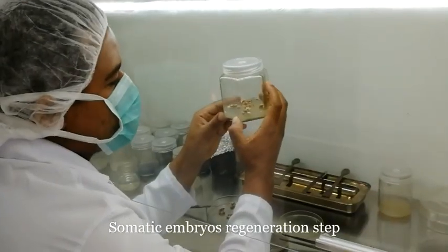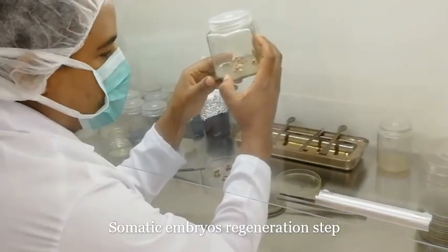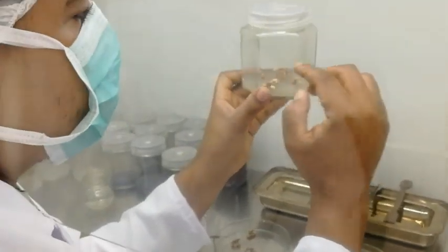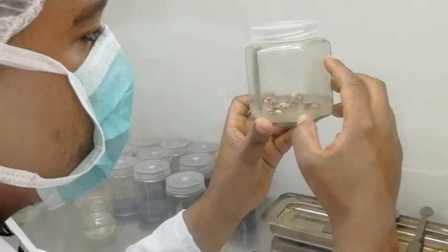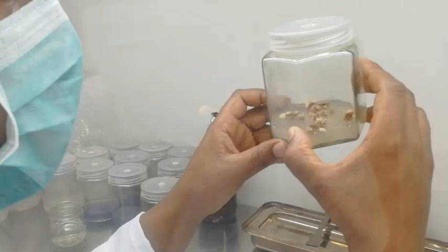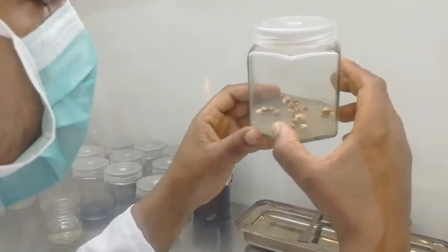I'm going to demonstrate the regeneration steps. Under this activity, we will identify the embryogenic callus from this jar. Embryogenic callus development is clearly observed when the callus turns yellowish or sometimes brown.